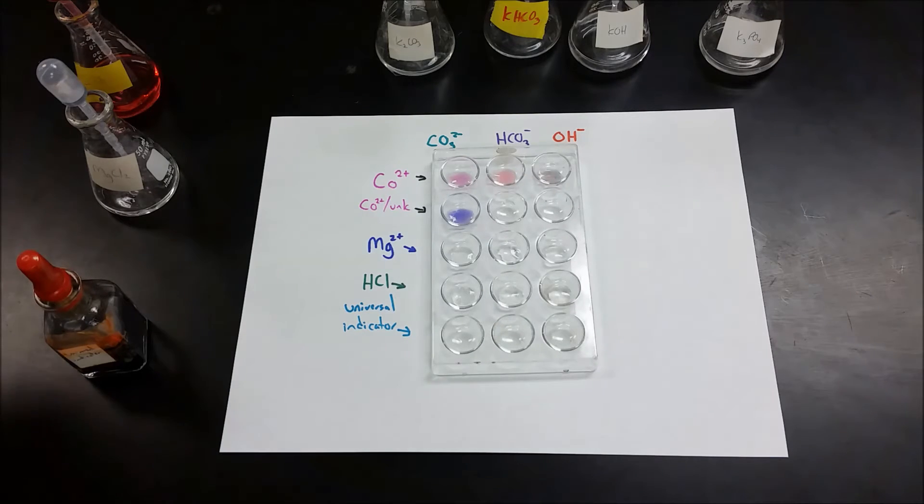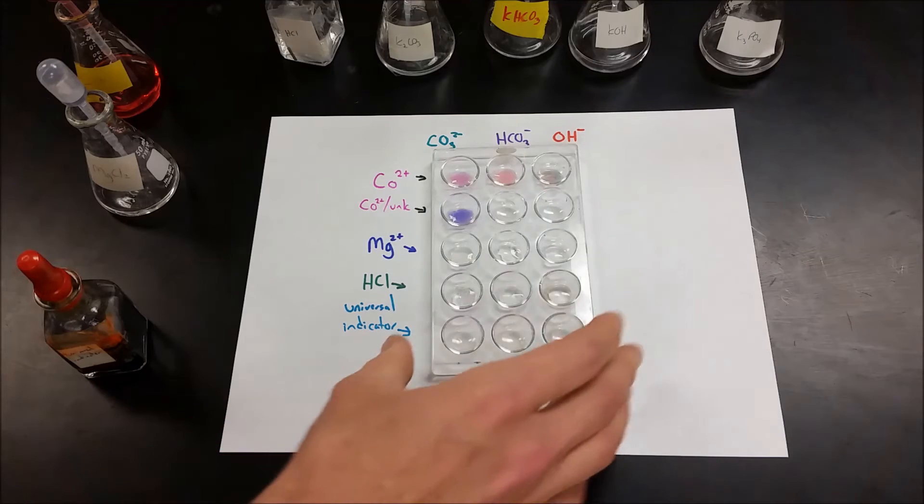The problem is that sometimes you'll get a little bit of bubbling with the hydroxide as well, and the phosphates can as well too.